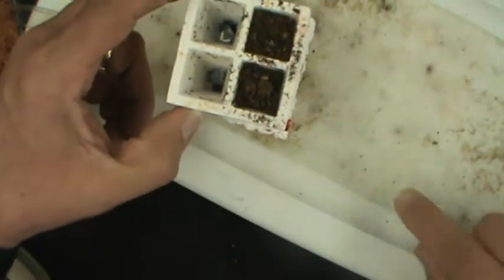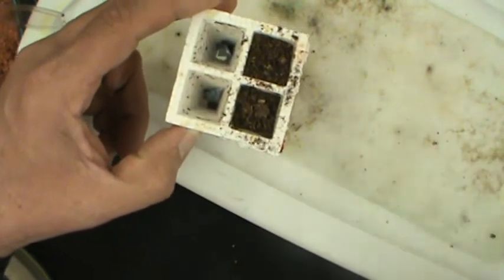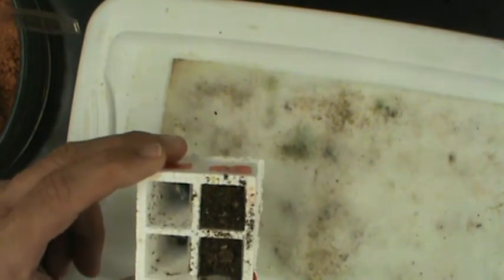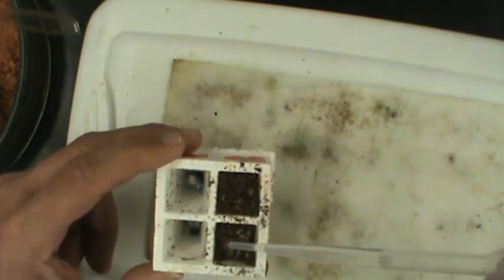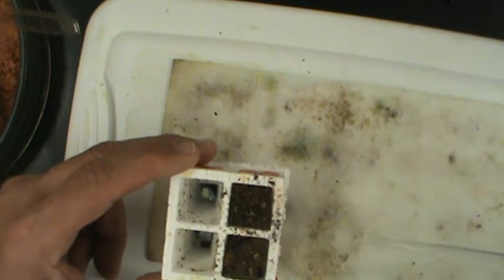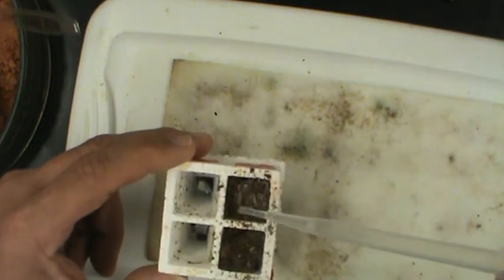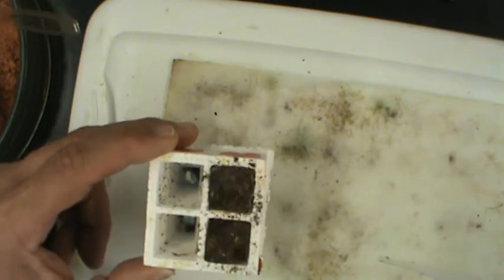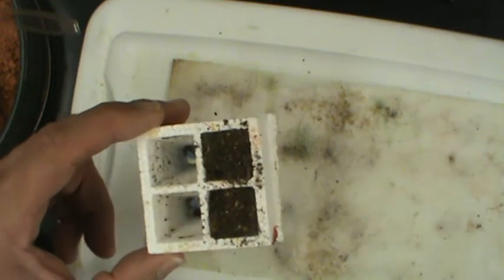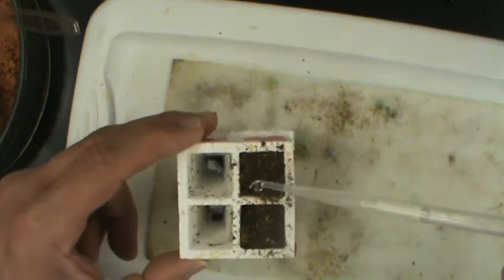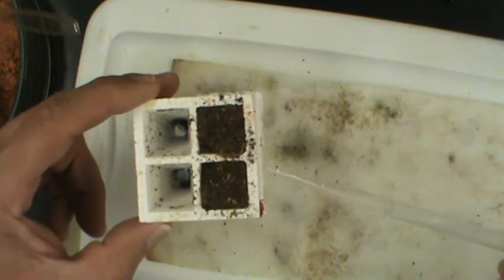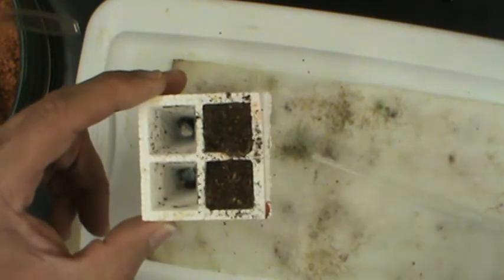We want to use this to supply water to our germinating seeds and plants. But in order for this to work, we have to make sure we have a complete column of water all the way up through the quad. So we need to take a dropper and drop water onto the surface of the soil and let it soak all the way down through until there is water dripping out the bottom through your wick, so the wick is also wet. What this ensures is that we have a continuous stream of water from the wick up into the soil up to where the seeds are. Think of the cohesive and adhesive properties of water that enables this to happen.